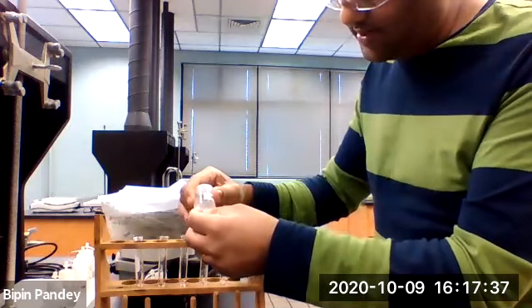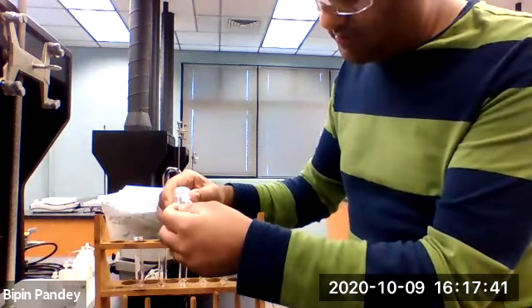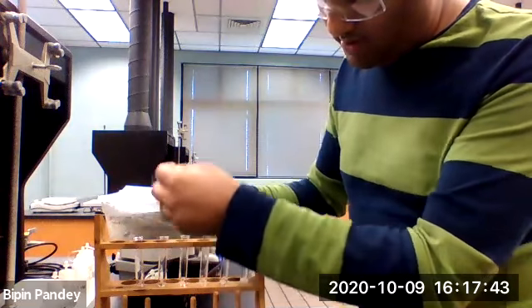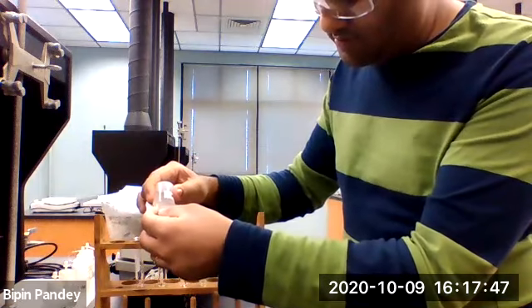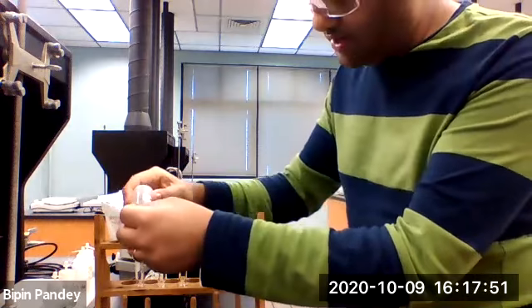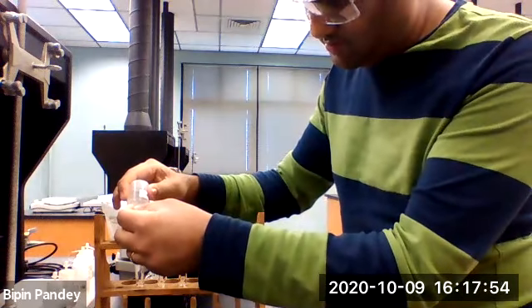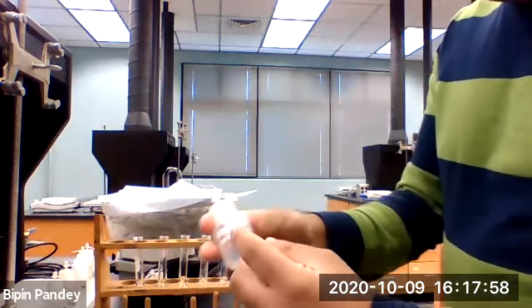Nothing happens in the second test tube. Nothing happens in the third test tube. In my unknown A, nothing happened. Unknown B gave no reaction. Unknown C also gave no reaction with barium nitrate.